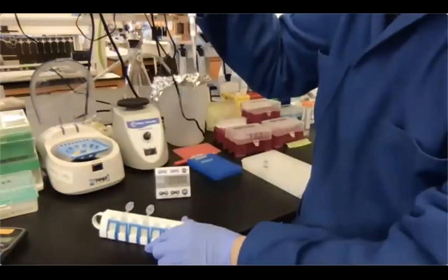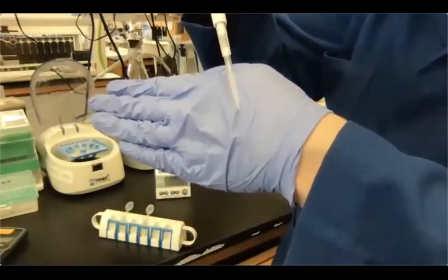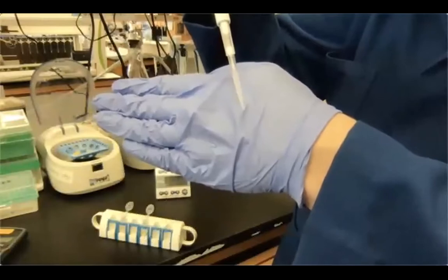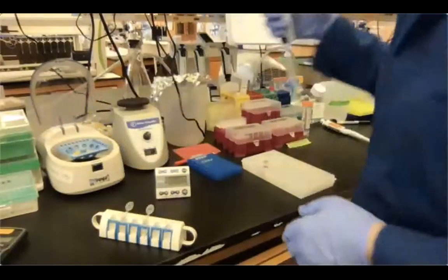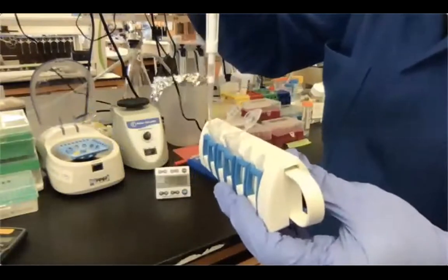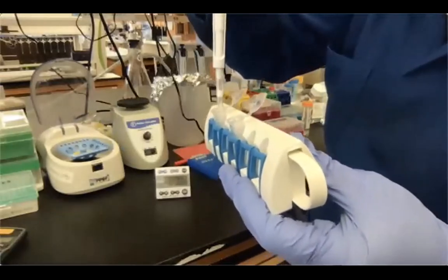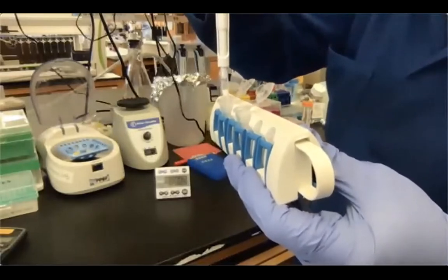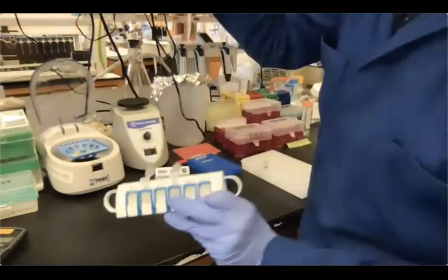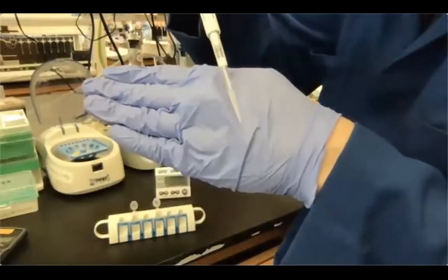There are still a few microliters. I know you cannot see it, but trust me, you still have a few microliters in the tube. And what I usually like to check is whether my supernatant has a brownish color at the tip. That would mean that I picked up some beads. In this case, it's totally clear, so I'm good to go. I can discard the supernatant. All right, setting my pipette to 85. I'm repeating exactly the same thing, facing away from the magnet, which is the same as facing away from the bead pellet. I'm going in, removing the supernatant slowly, and then coming out. Again, a few microliters left in my tube, and checking the supernatant, it's clear, so I can discard it.